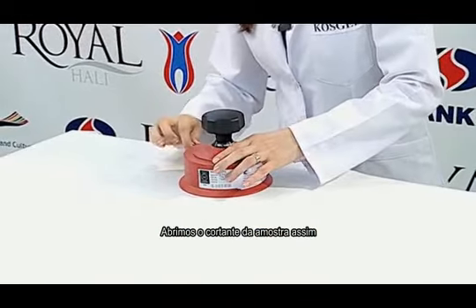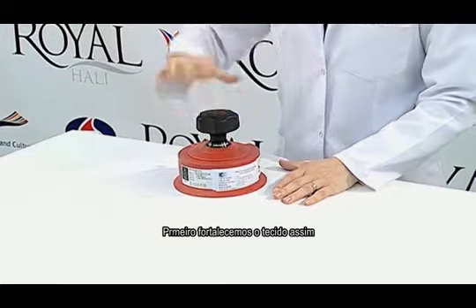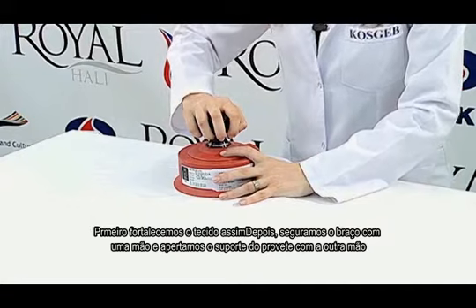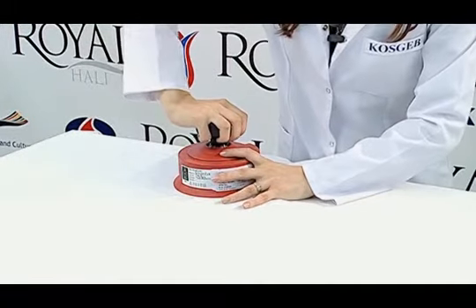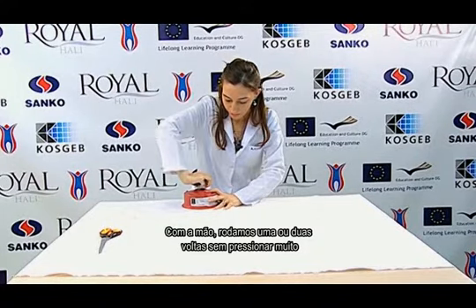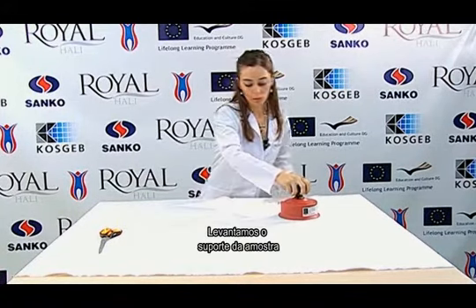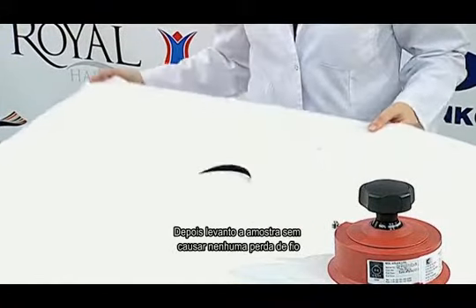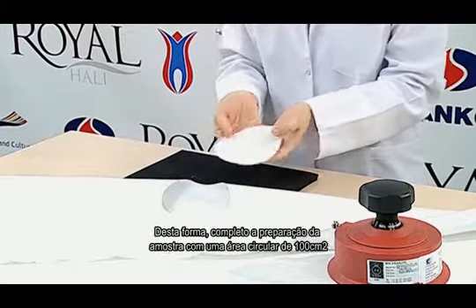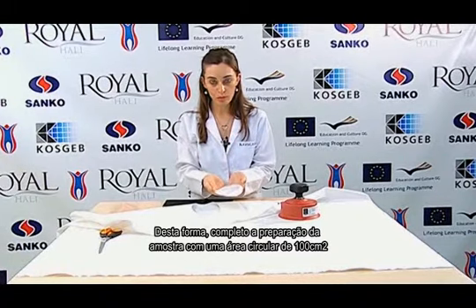We open the sample cutter's pin like that. First, we straighten the fabric like this. Then, we hold the arm with one hand and tighten the sample holder with the other hand. With our arm, we turn it for 1 or 2 turns without pressing too much. We lift the sample holder. Then, I lift the sample without causing any yarn loss. This way, I complete the preparation of the sample of a 100 square centimeter circular area.